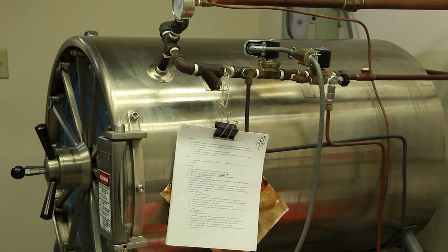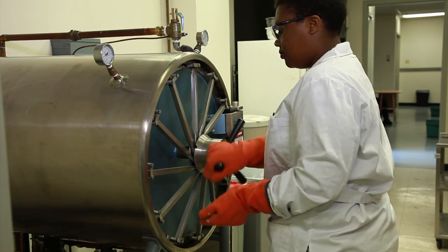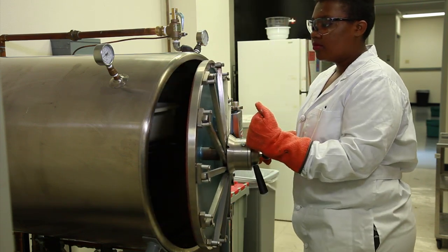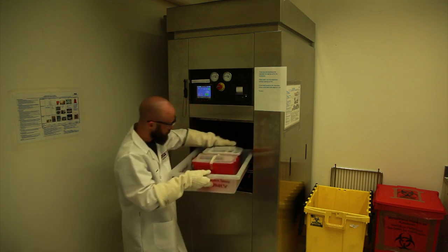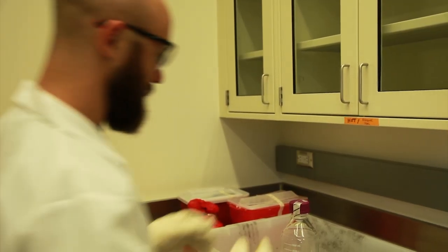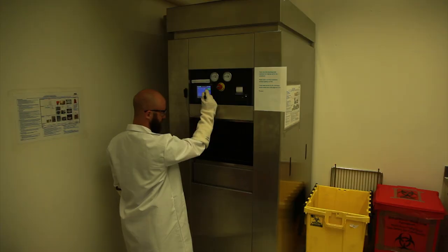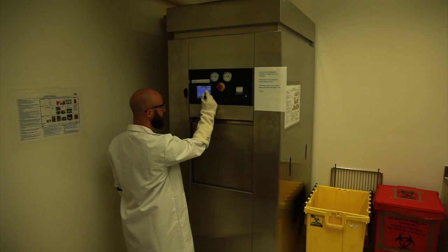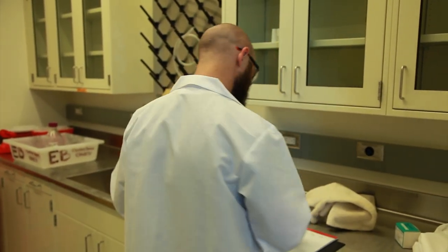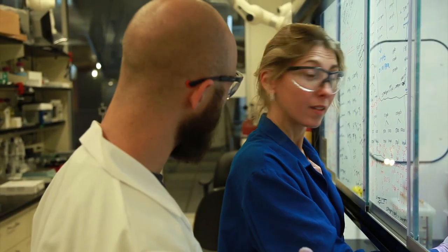Also, watch out for the hot metal parts on the autoclave. If applicable, allow the autoclave load to stand for about 10 minutes in the chamber. This will allow steam to clear and trapped air to escape from hot liquids, reducing risk to operator. Cautiously remove items from the autoclave and, if available, place them in an area which clearly indicates the items are hot until the items cool to room temperature. Do not agitate containers of superheated liquids or remove caps before unloading. Shut autoclave door, but do not let it pressurize. Sign the autoclave logbook as a successful run or note if there was a spill or if the autoclave malfunctioned in any way. Immediately notify the supervisor if there was a problem with the run.